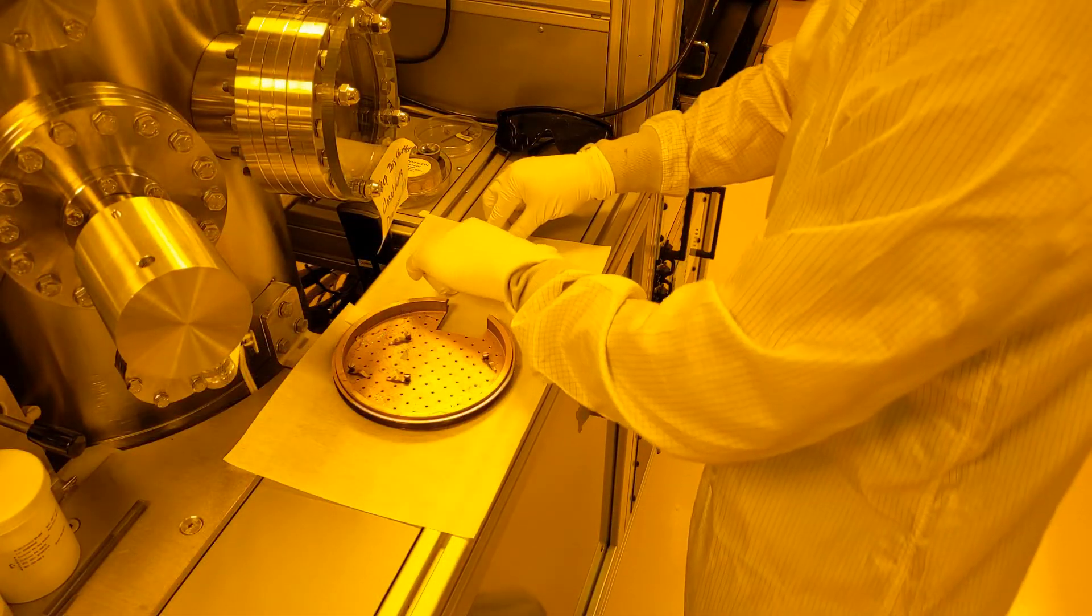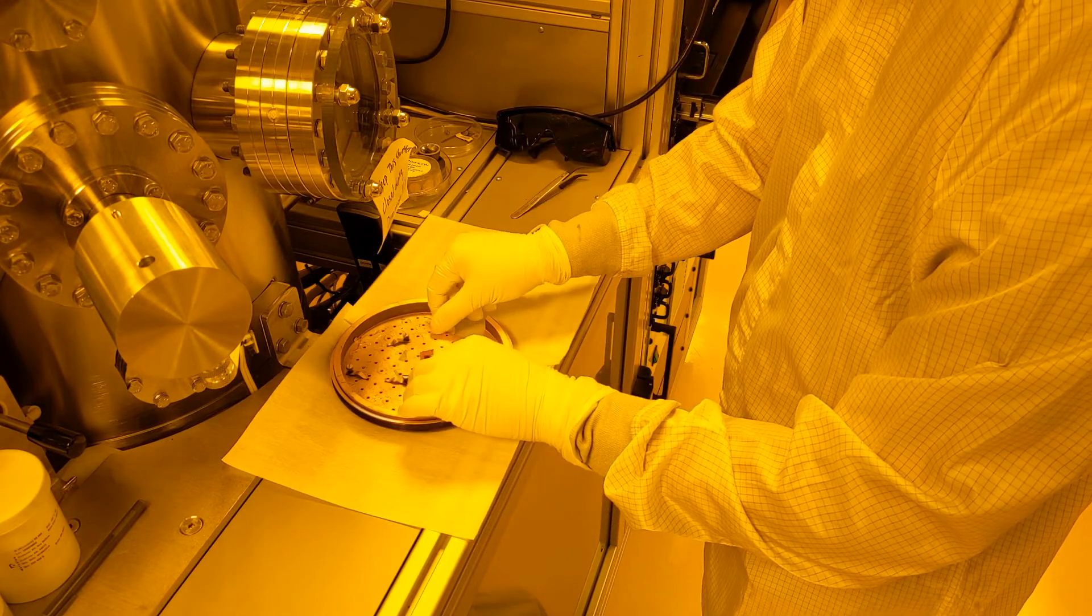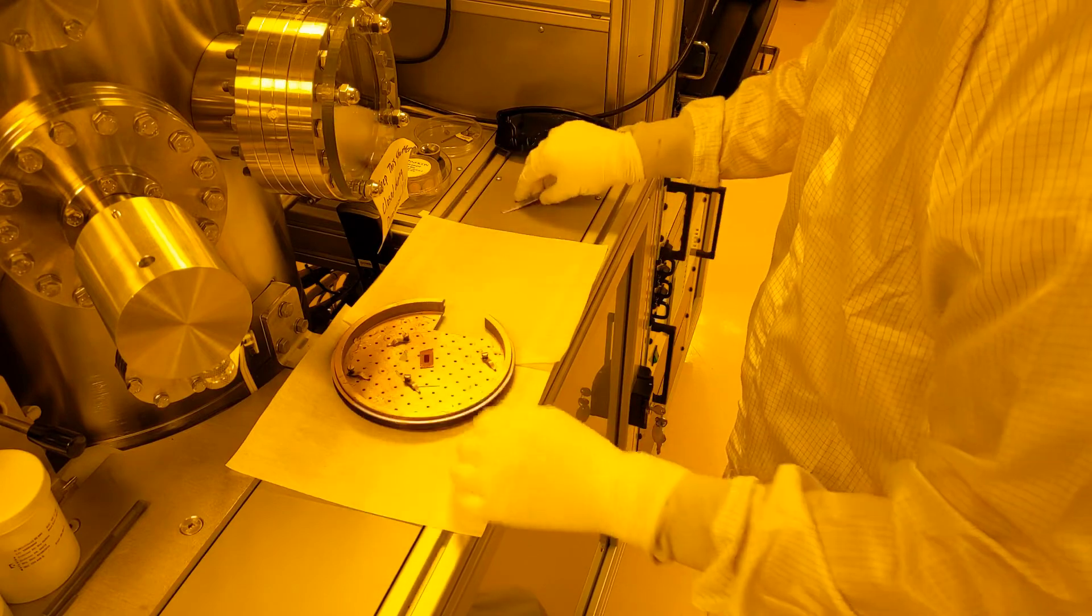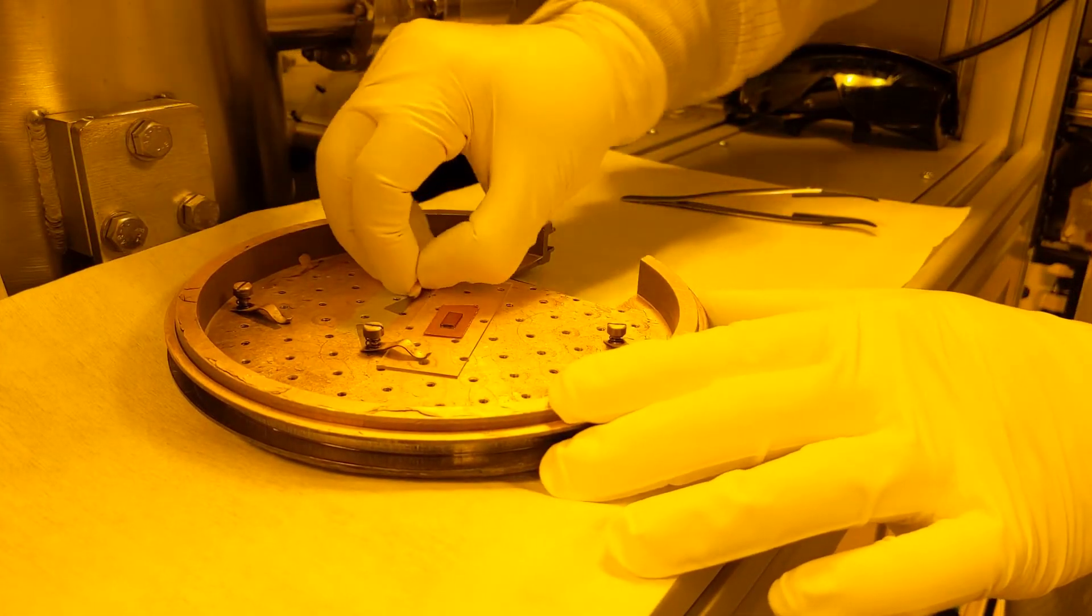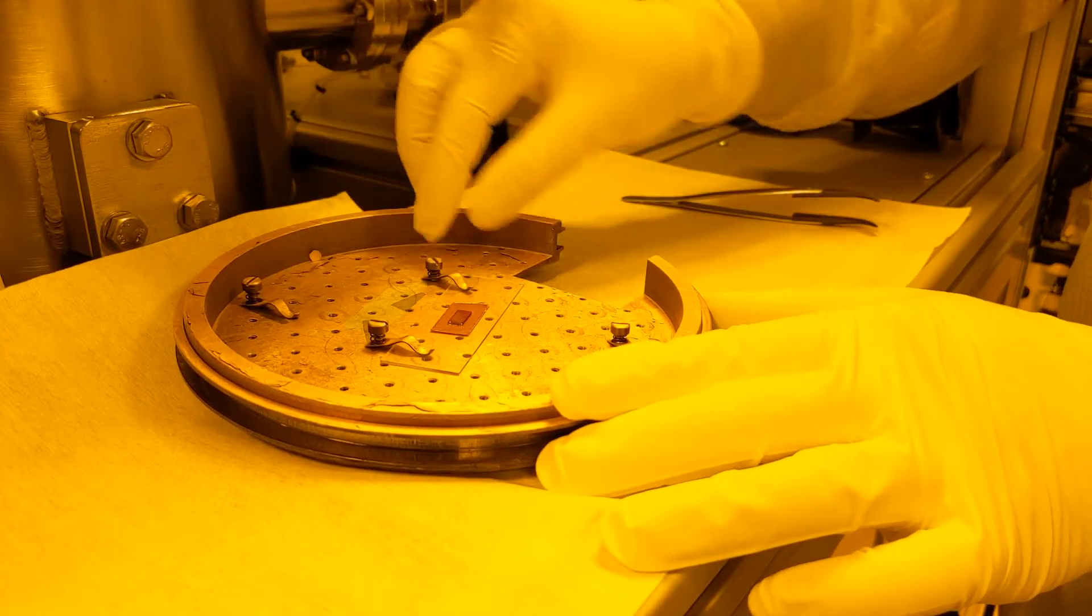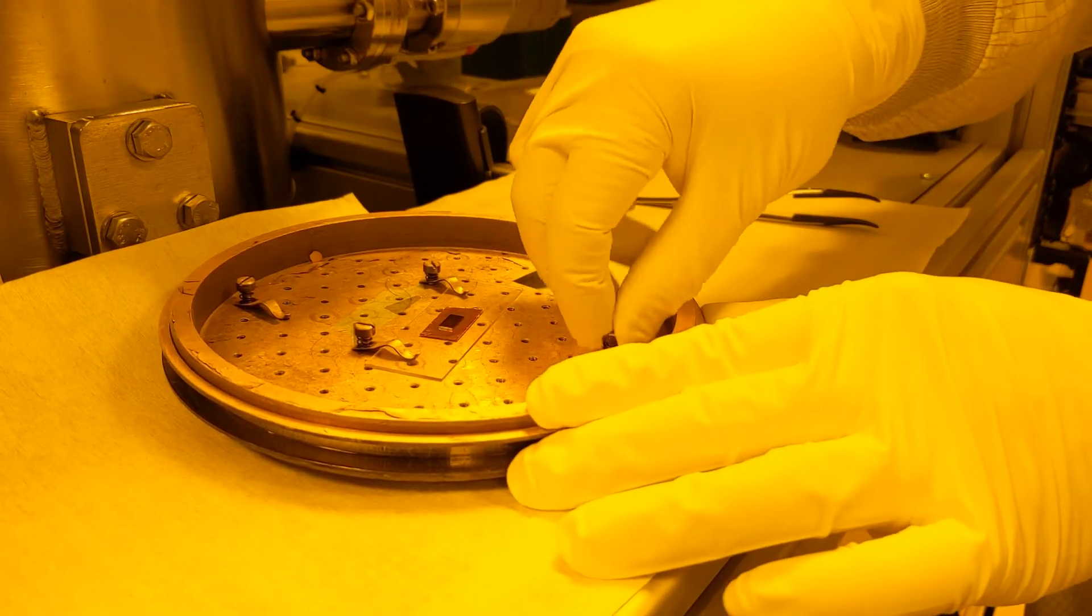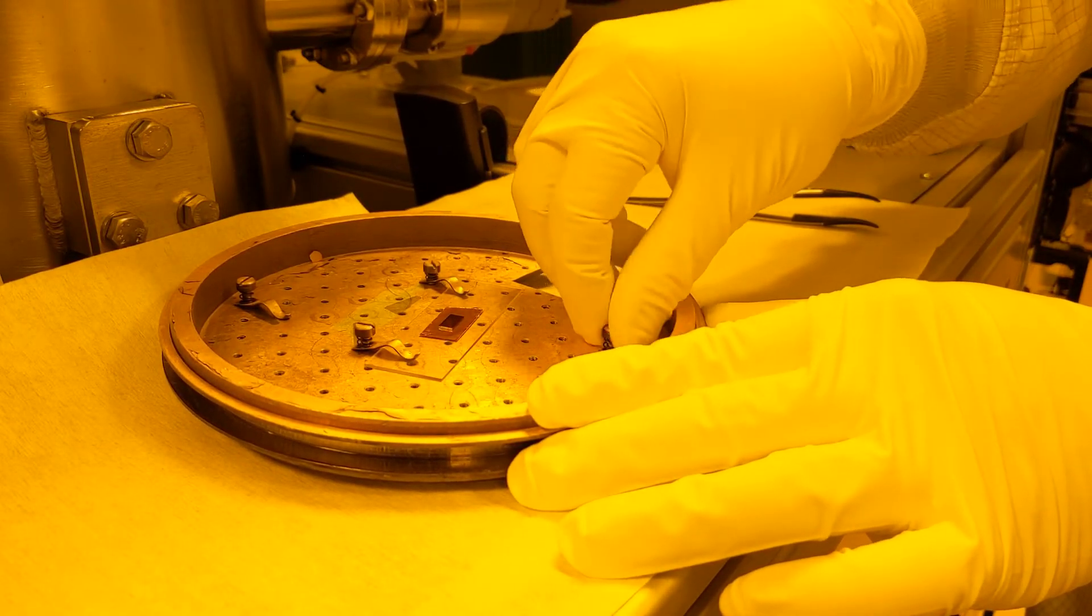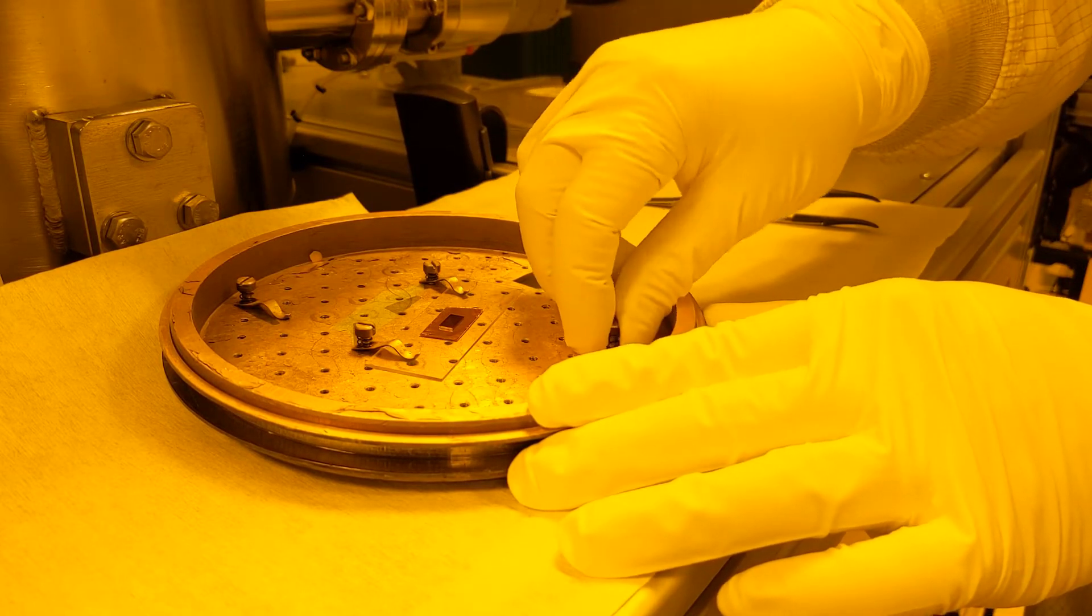Affix your samples using the spring-loaded clips. Notice that they consist of a few parts and are spring-loaded, so that you can lift them and slide a sample underneath without needing to loosen the screw. The spring pressure is more than sufficient to hold your sample in place. If you need to move clips around you may, but please do not use a screwdriver on them as they are very easy to strip. Finger tight is plenty.